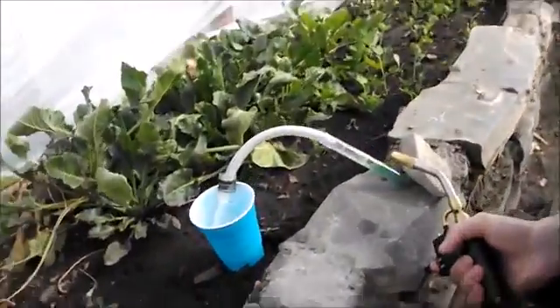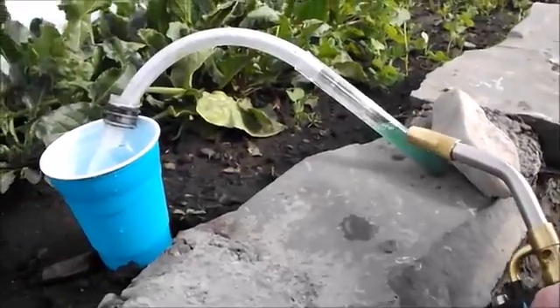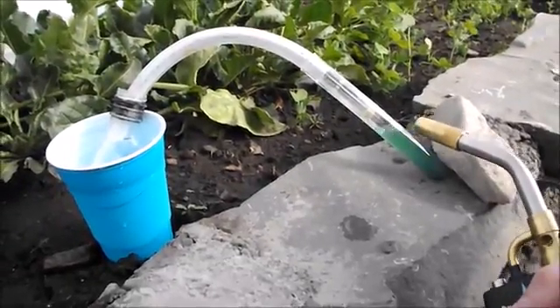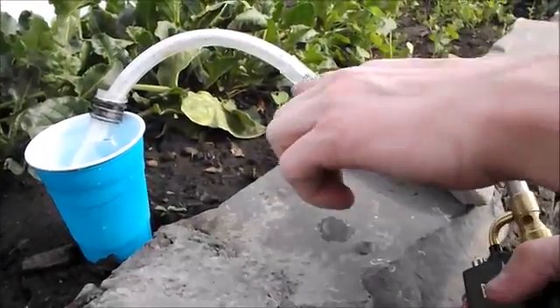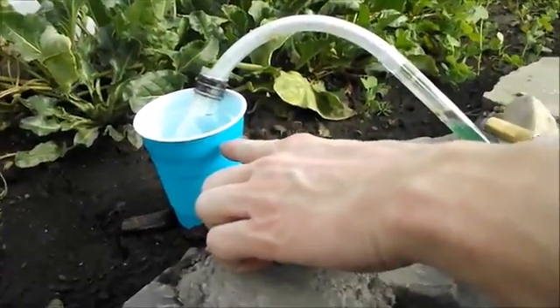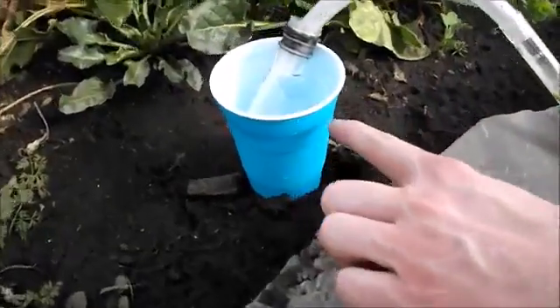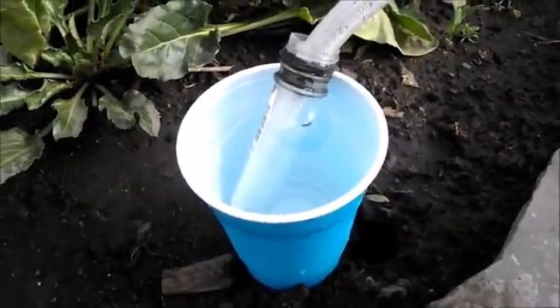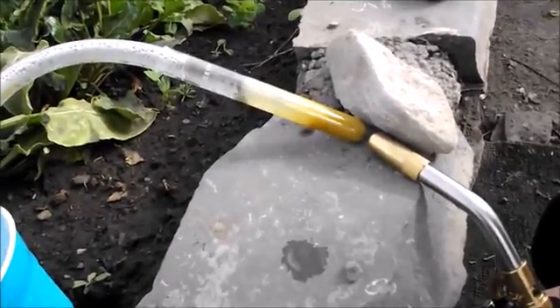Alright, so I'm very carefully distilling it here. You can see I'm just heating the top of the solution so it boils up, goes down, and condenses in this tube. I'm holding my beaker down there in a cup of cold water to help it condense. Looks like we're just about there.